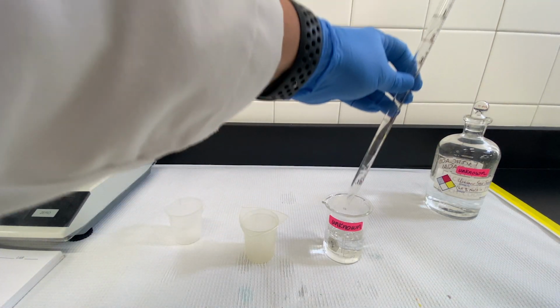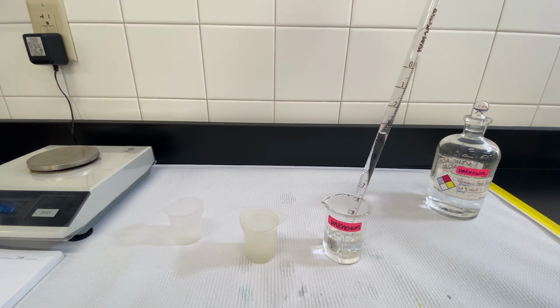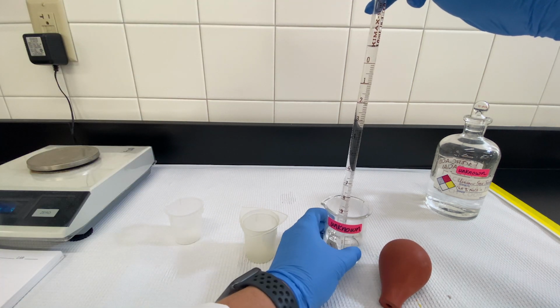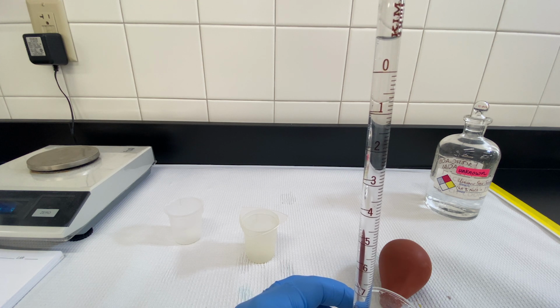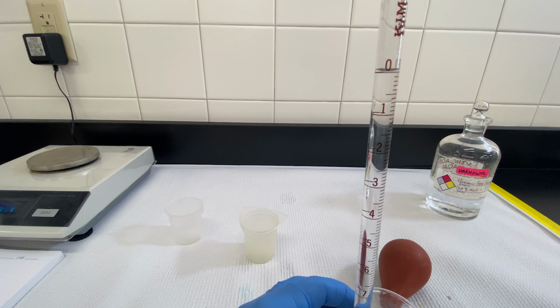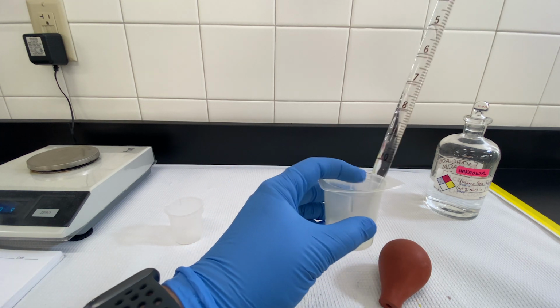As usual, you're just going to need two pieces of data. You're going to need the mass of that liquid, and you're going to need the volume of the liquid. The volume is going to come from a direct reading of your Mohr pipette, final volume minus initial volume. And your mass is going to come in the form of an empty beaker and an empty beaker with the water in it. Again, these are the same principles that you've learned in the mass experiment and the volume experiment.